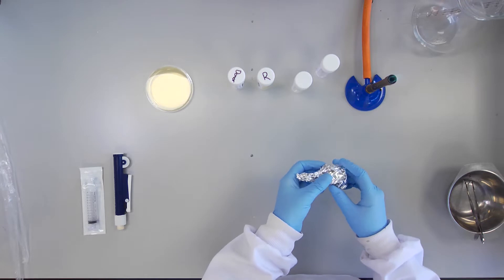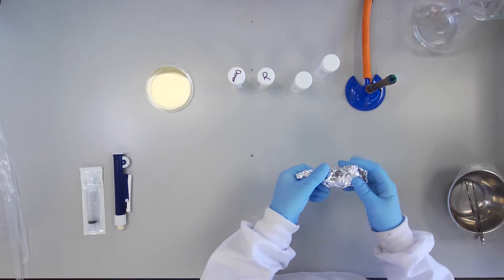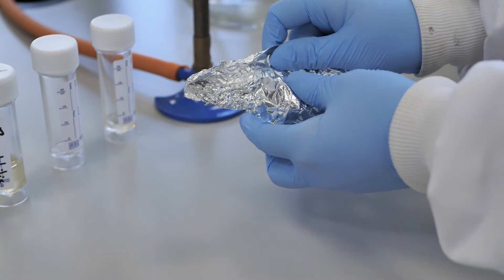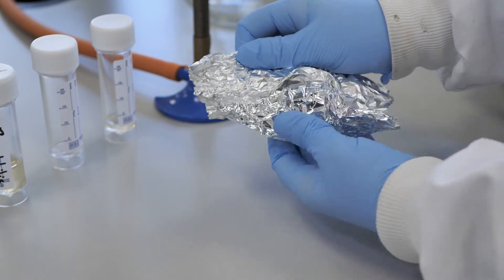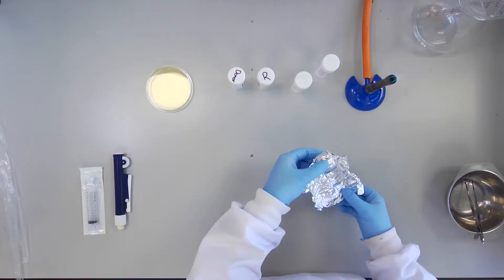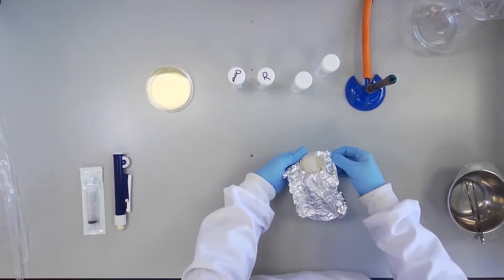Near the Bunsen burner, open the tin foil wrapper containing the filter. Check that the white O-ring is in the correct position.